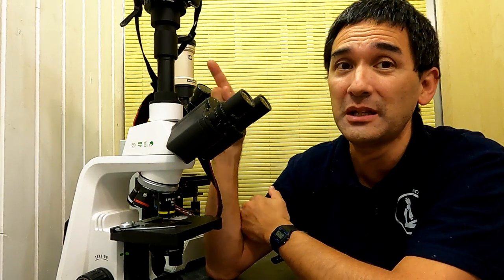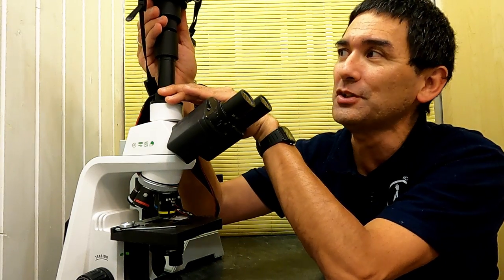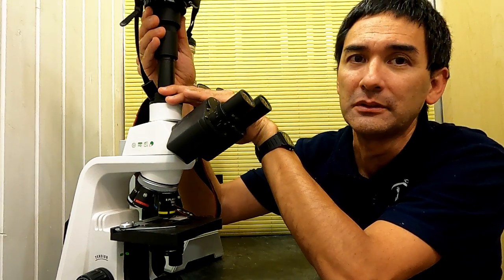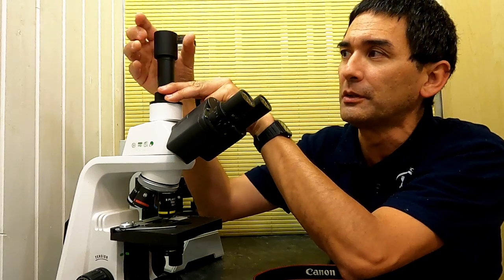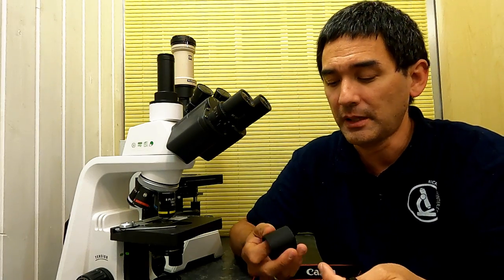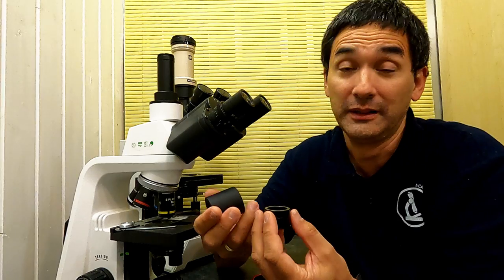It is possible to take pictures this way, but there's a small drawback that it's still not parfocal. This means you actually have to lift it out several centimeters for the image to be in focus. So it's very impractical, and also it's not very stable. You can see it's still wobbly, and without this eyepiece adapter in here, it's even more wobbly. So honestly, I don't really see a function for this tube here at the top, which is, I think, a pity, because, as I mentioned before, the machining and so on looks very nice, really. But I think it's kind of misdesigned a little bit.